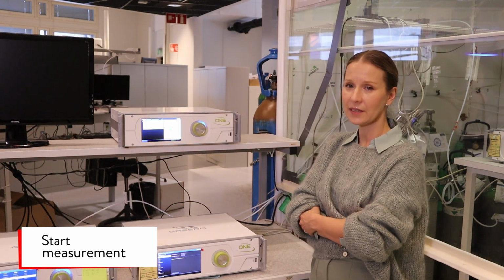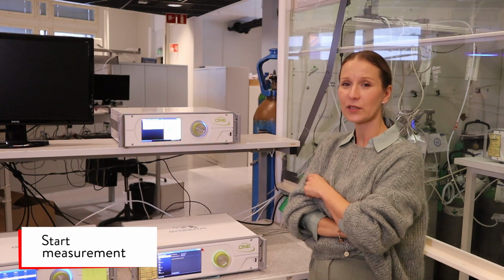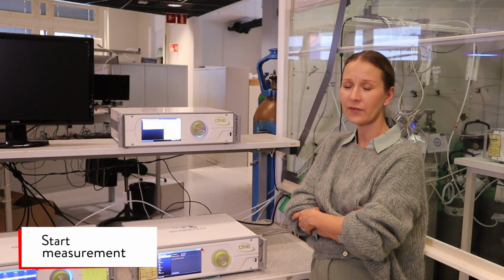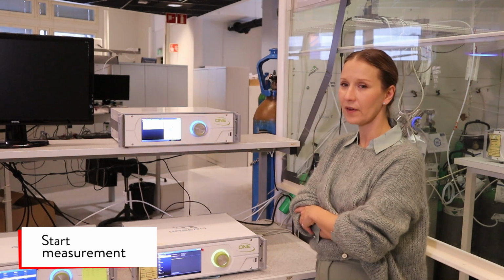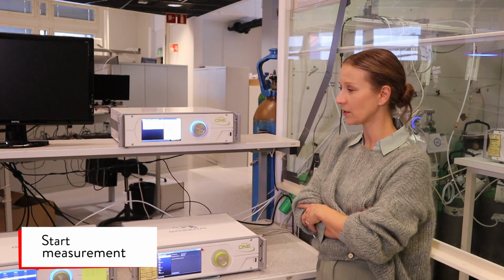First, the device does a 6 1-second long pumps and then a pressure adjustment. Now the filter wheel is turning and the device is measuring all the optical filters. The measurement iteration lasts 35 seconds to 2.5 minutes depending on how many gases are measured.